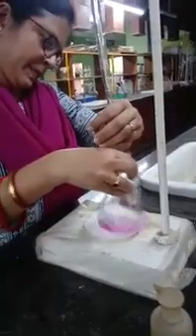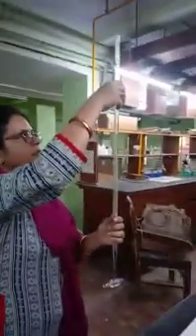The pink will last and this is the end point. With 1 drop you can see that there is a pink color. The faint pink color, you will have to maintain this color. Remember, it cannot be dark, it cannot be light, in the titration of sodium hydroxide against oxalic acid.